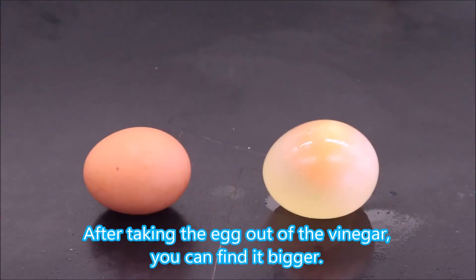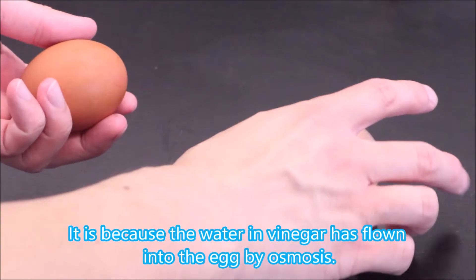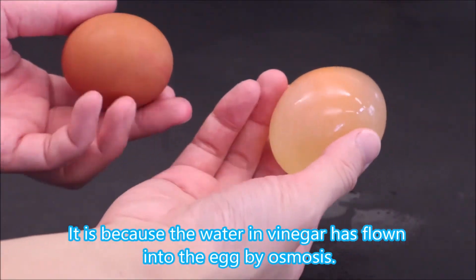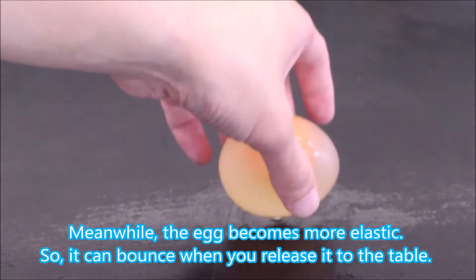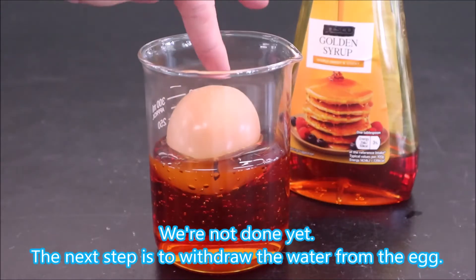After taking the egg out of the vinegar, you can find it is bigger. It's because the water in the vinegar has flowed into the egg by osmosis. Meanwhile, the egg becomes more elastic, so it can bounce when you release it onto the table.